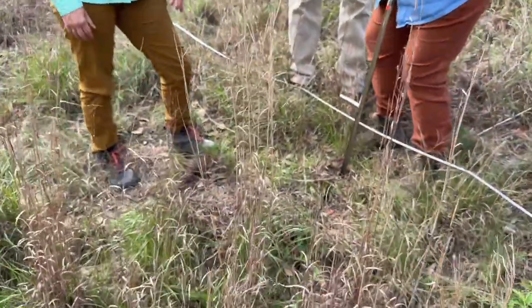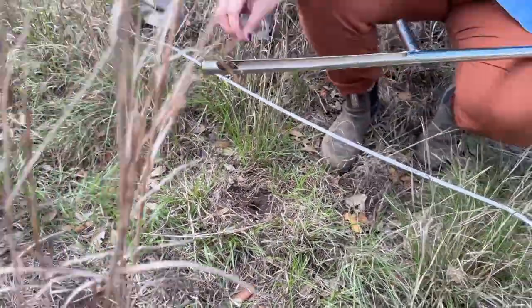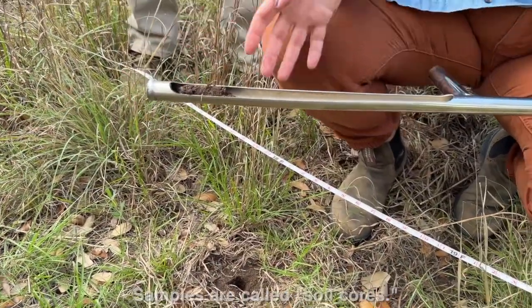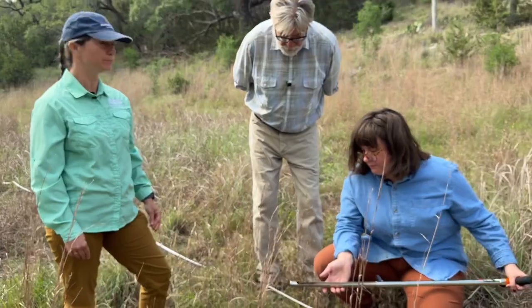And we're only collecting the first 10 centimeters of soil. And so then we just put it in and pull it out. And this is one of our soil cores. So that looks pretty uniform. That looks like really great, dark, organic matter rich soil.